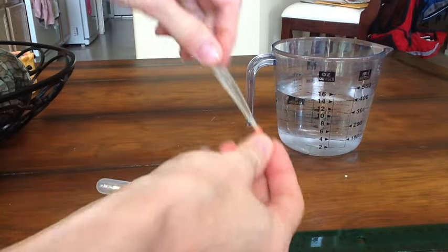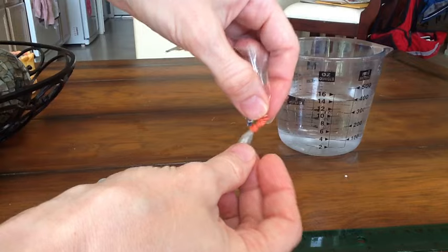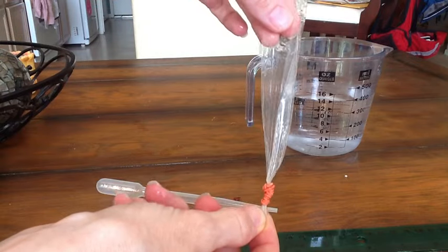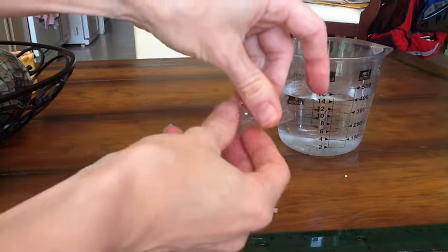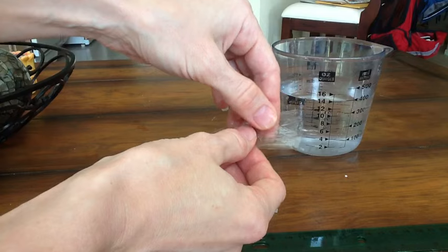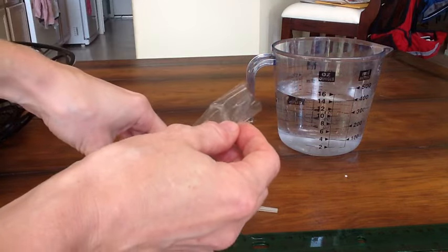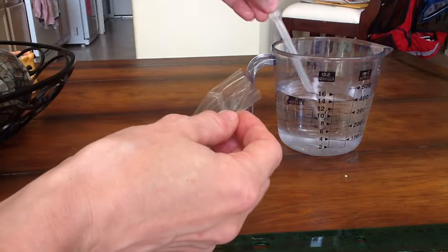And you will wrap these around several times so it's kind of important that you get a thin rubber band and also a rubber band that doesn't stretch out very much so that you'll save yourself some time wrapping it. Okay I've made a really secure end here and now the next step I have to do is take this open end and fill it with our solution.